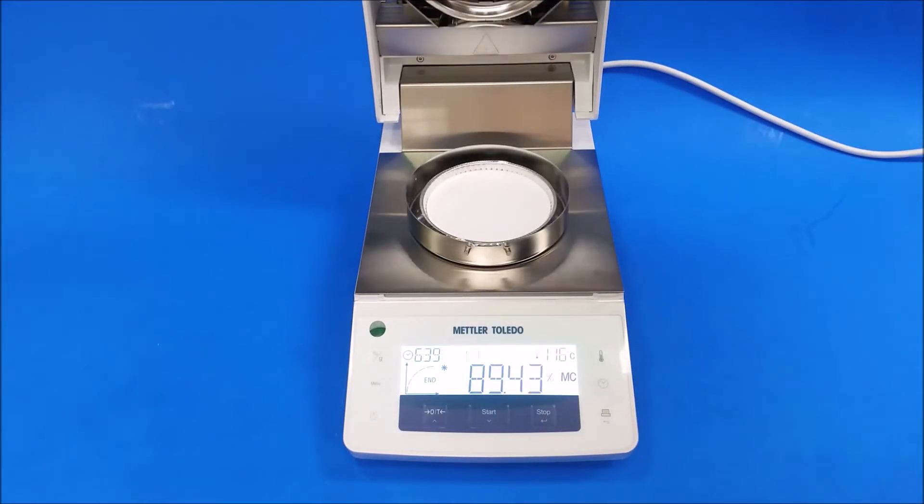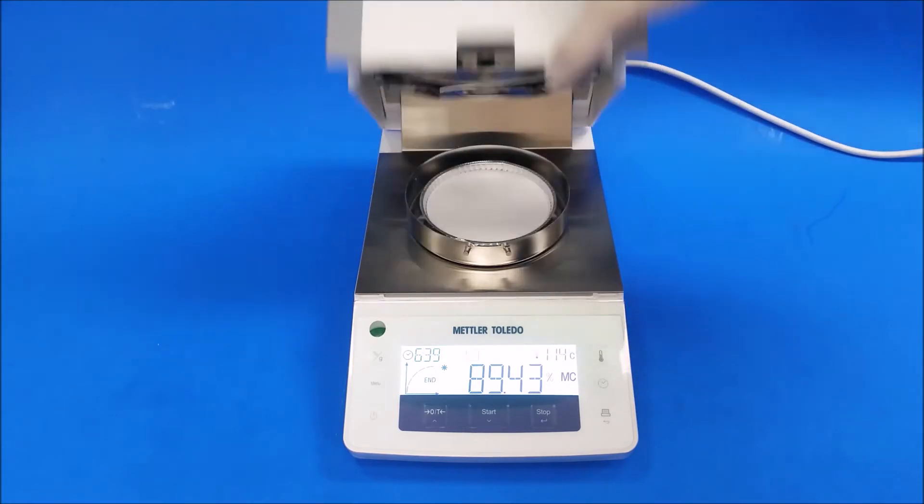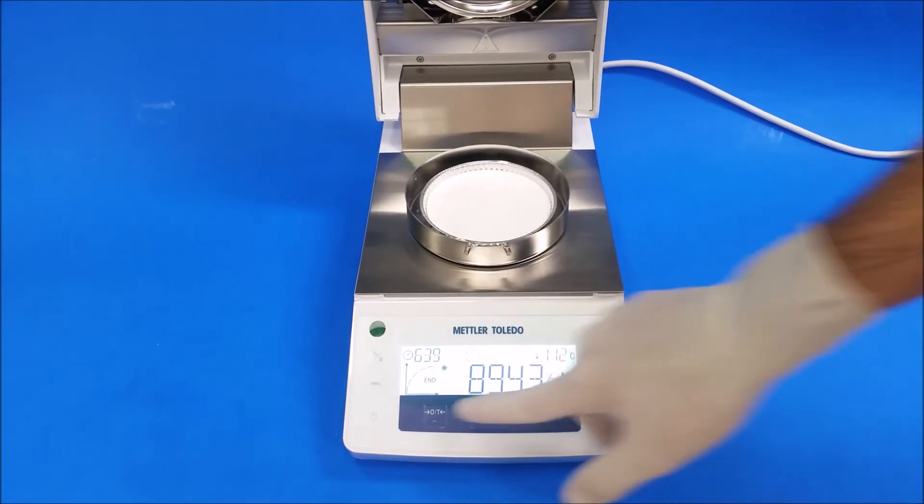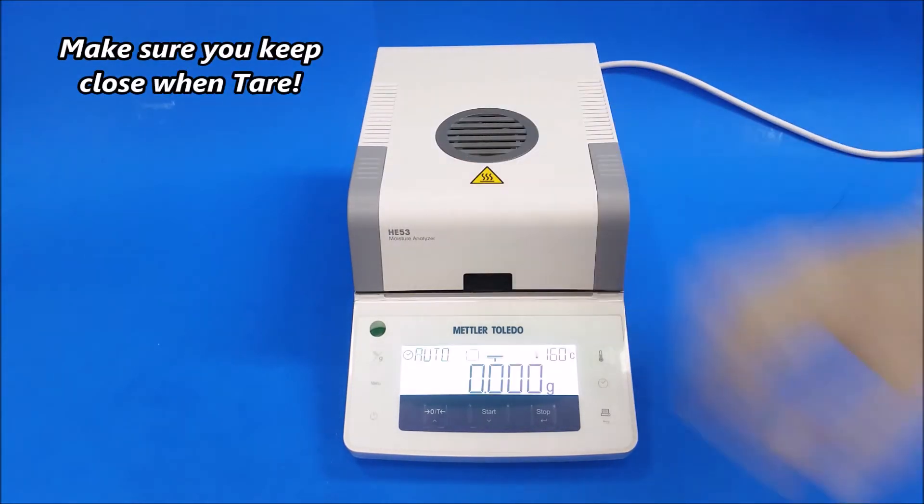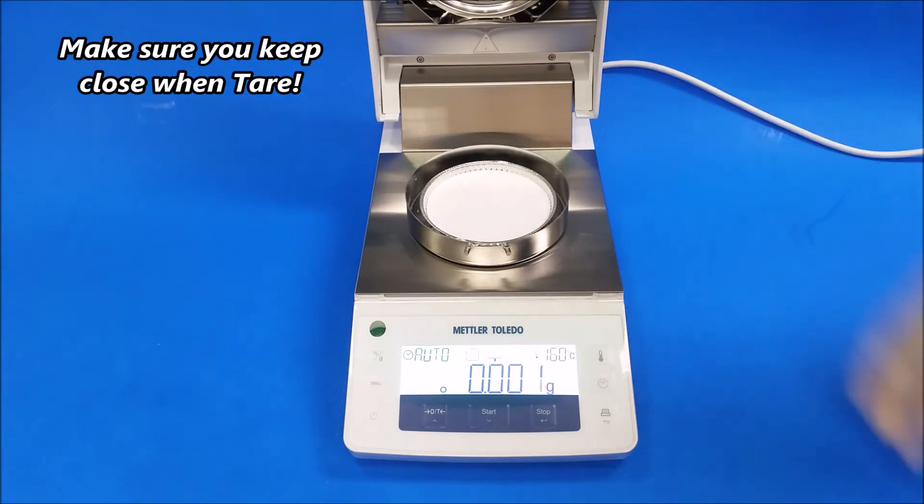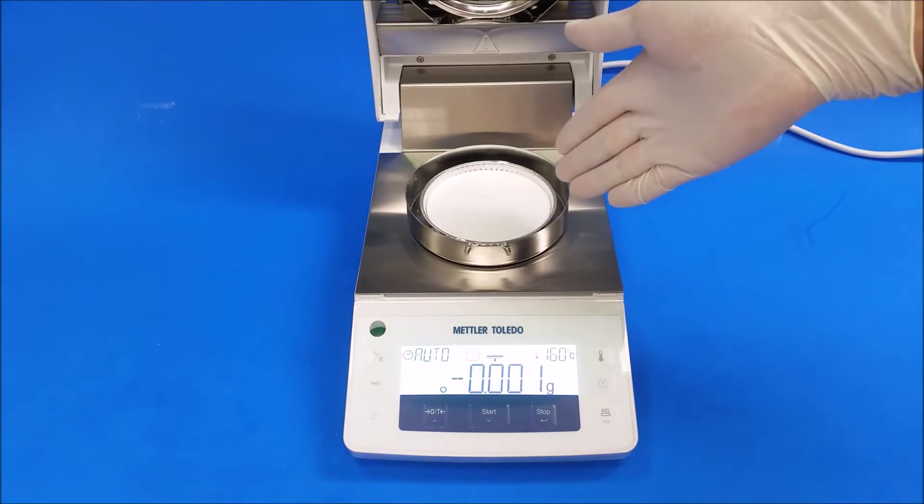And you're going to make sure you close the hood before you tare it, unless you guys want to hear this every time. Once you have a tare, open it up, you're ready to add a new set of samples or run another sample.